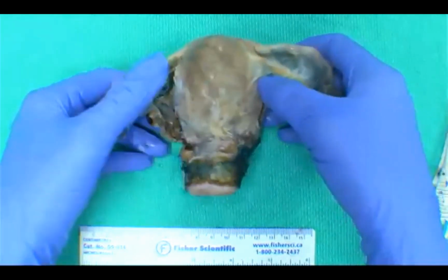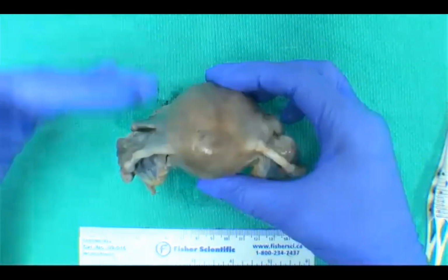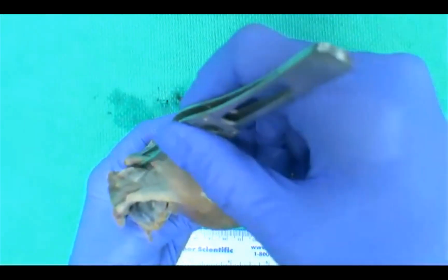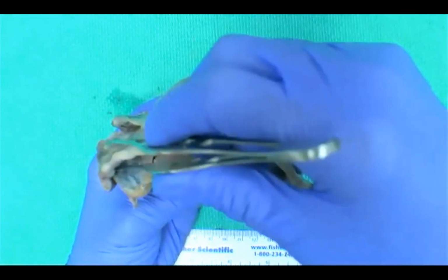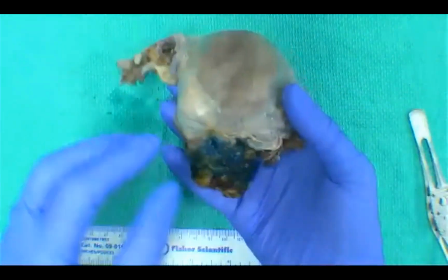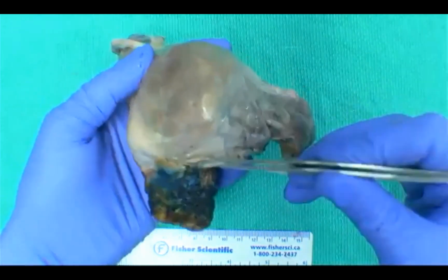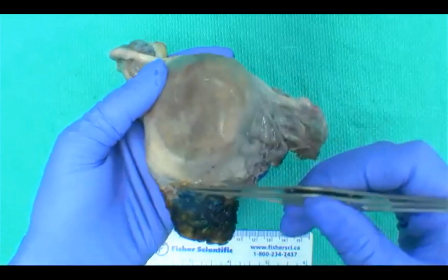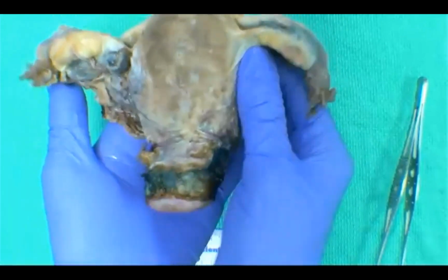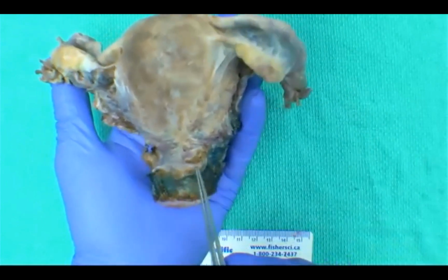When you have tubes and ovaries, it's easy to orient these types of specimens. So from anterior to posterior, you see from the top view here, you're going to have your round ligament, most anterior, then your fallopian tubes, and your ovaries. Alternatively, on the anterior surface, you have this peritoneal reflection here, and it is higher on the anterior surface than posteriorly. So I'll turn this over to the posterior aspect. We can see here that the peritoneum is a lot lower and it sometimes comes to a point.